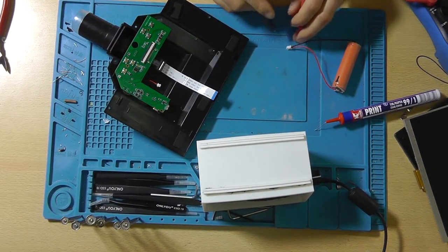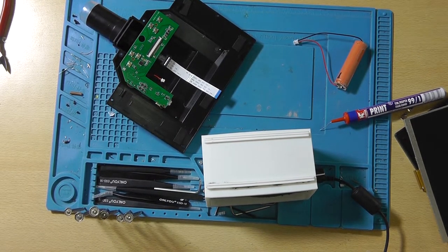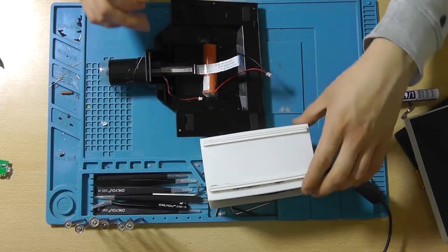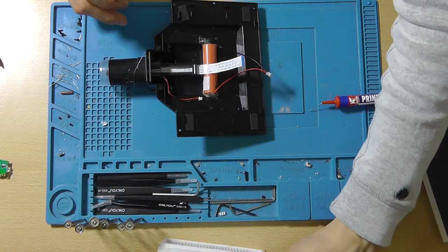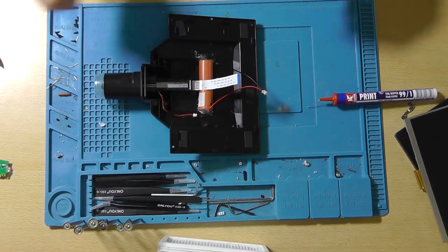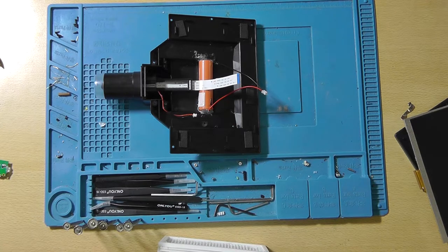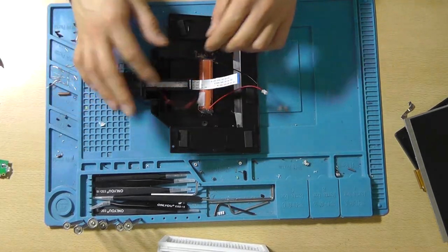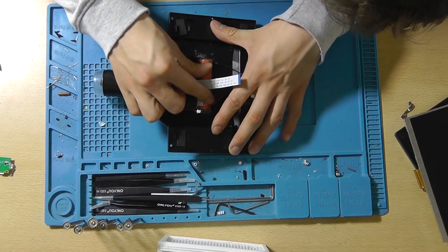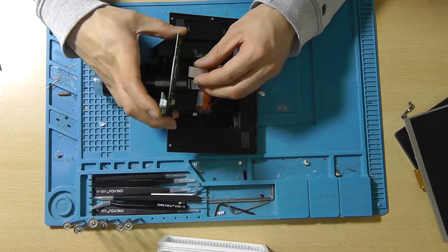Let's check if there's a voltage on the connector. Yeah, 4.1 volts. So that should be fine. The focus adjustment mechanism is able to slide on top of the battery. I won't use it at its full focus length range very much, so I think that should be okay. Battery is in place. Nice and steady. Let's connect the camera.